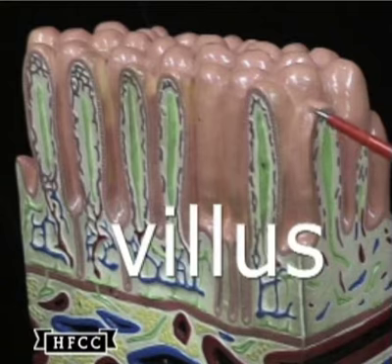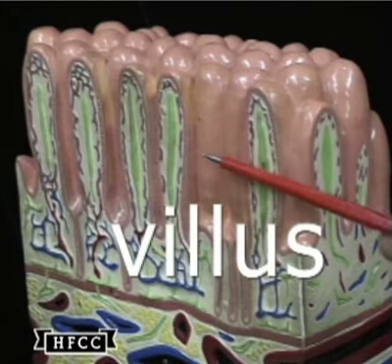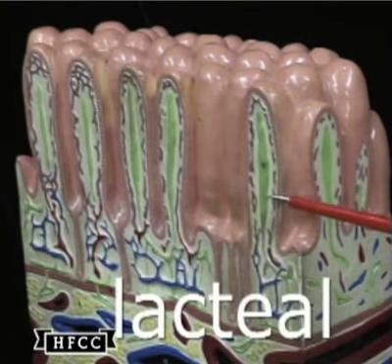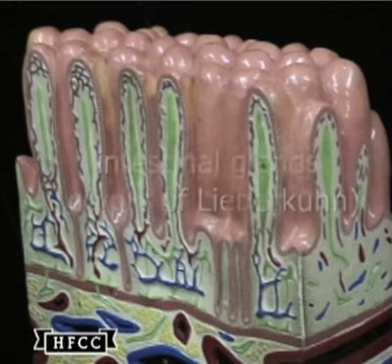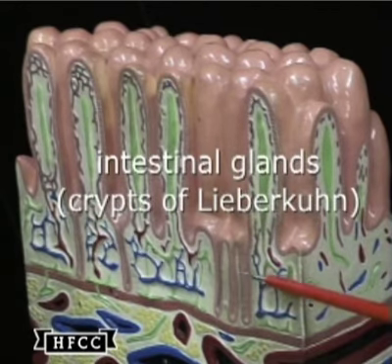A closer view of the villus, these finger-like projections. The center has a green structure called the lacteal, which will move the end products of fat digestion that absorbs down to the lymph system.